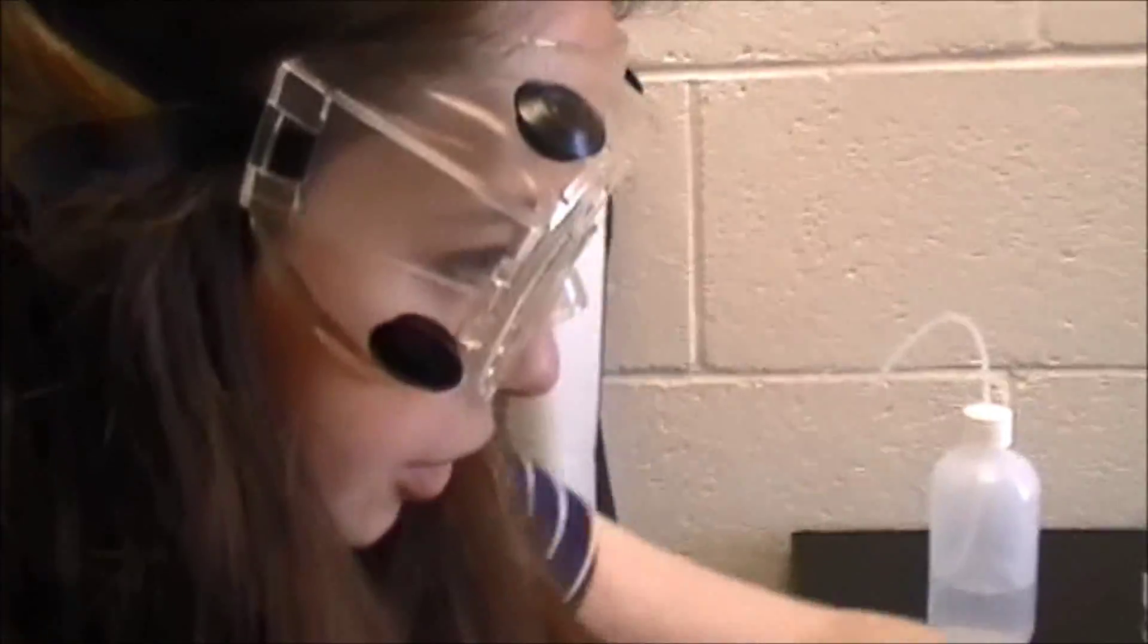All right, so what we're doing here is we are testing, oh my god, you're so close, we're testing acetate buffers.